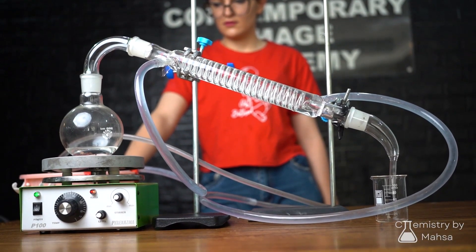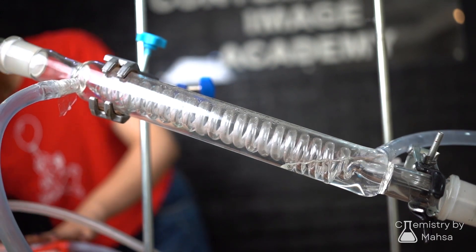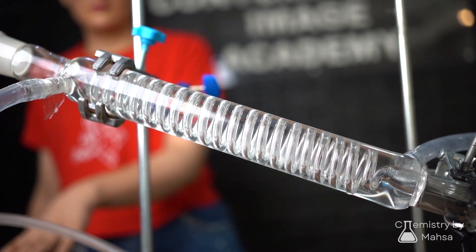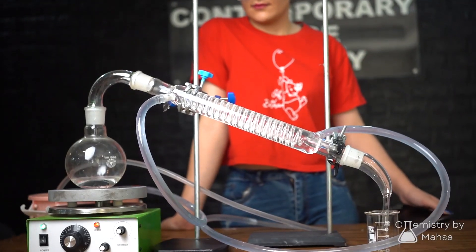For the next step, a distillation set was used to get rid of the DCM. After about 20 minutes, I saw crystals forming inside the flask, which I removed with a glass straw.